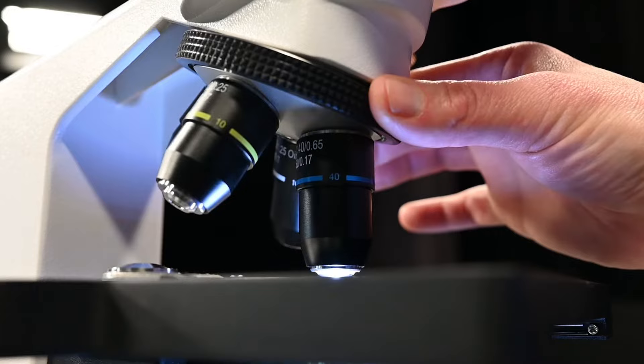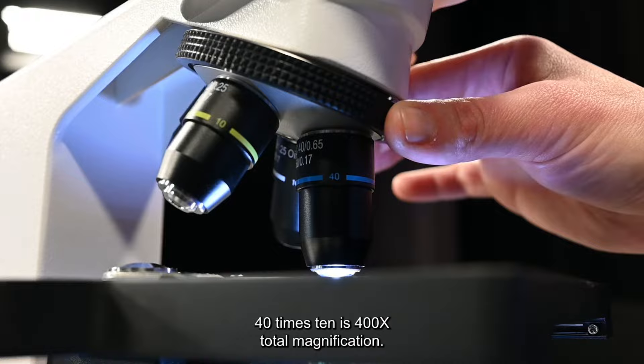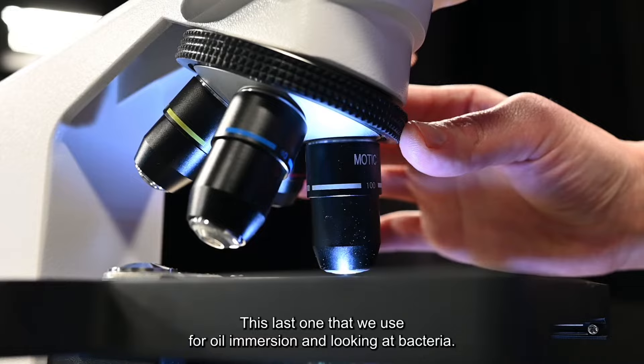The next one, hear it click. That's forty. Forty times ten is four hundred times total magnification.